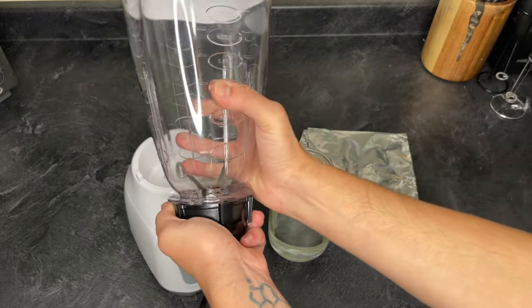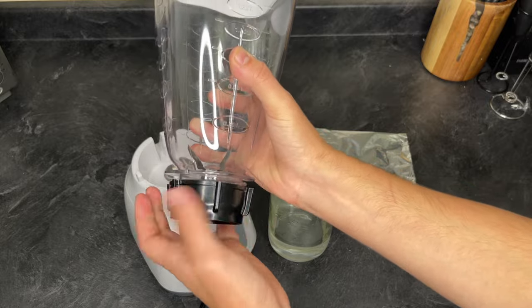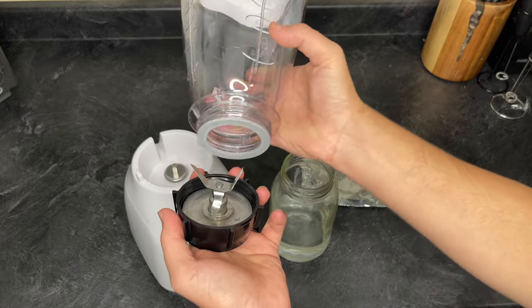So in this video I'm going to show you how to use a blender blade to break up that mycelium and make the jar usable.